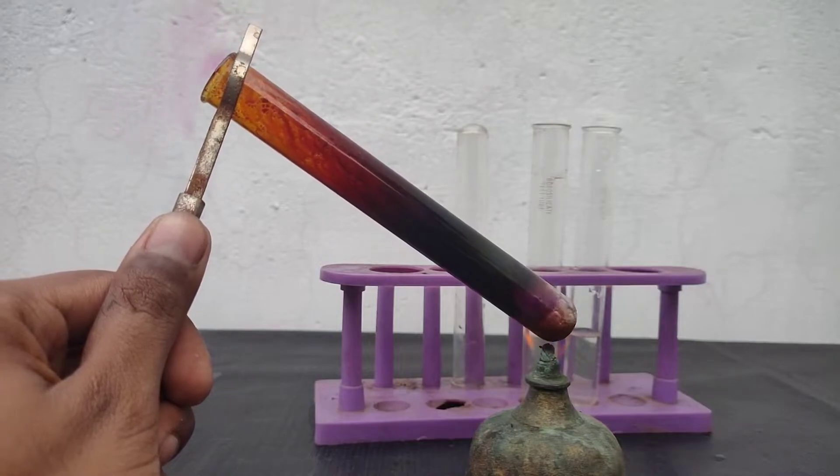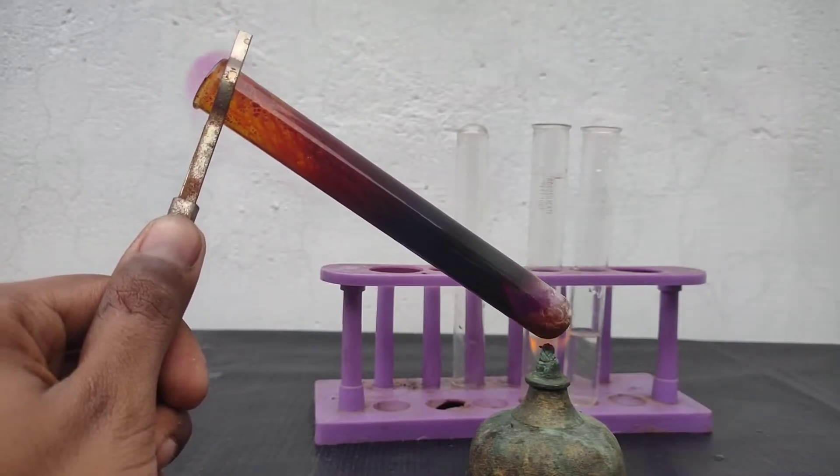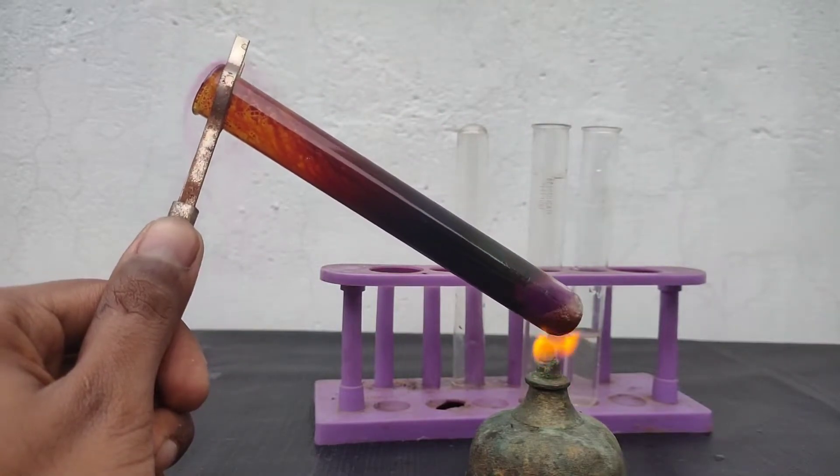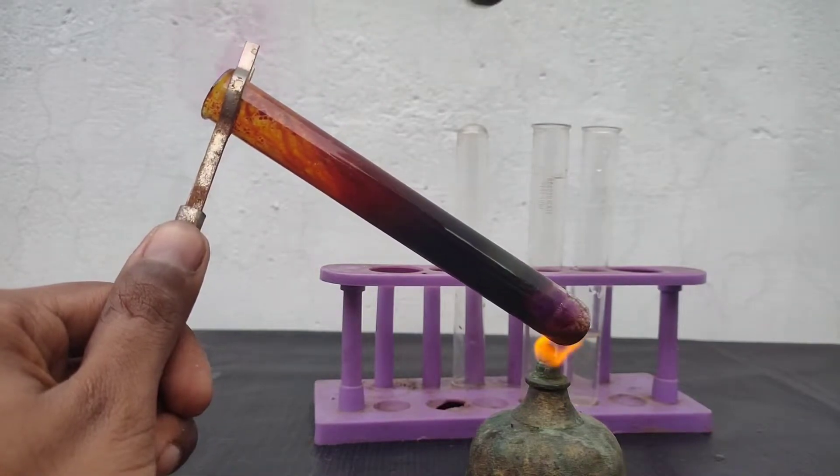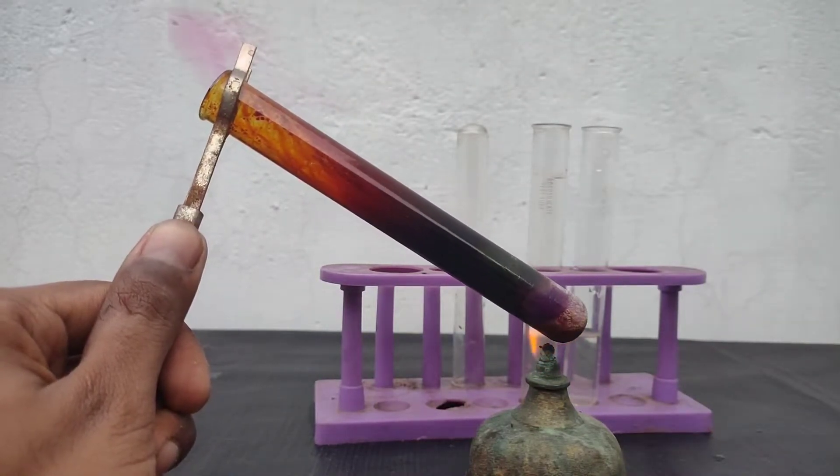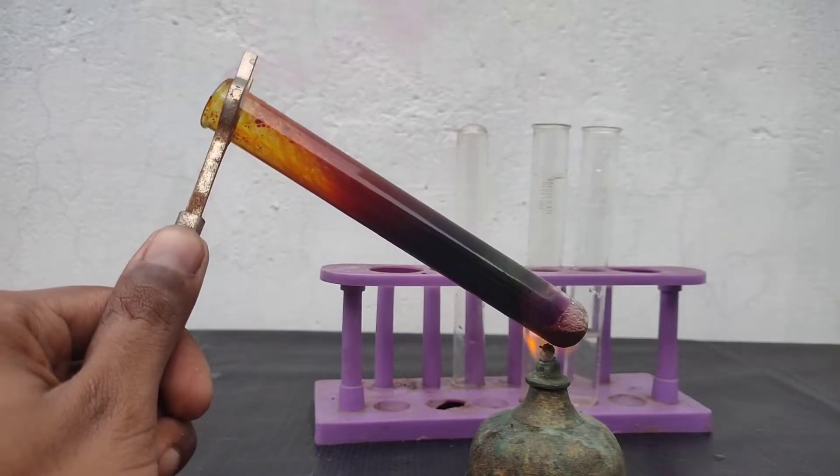These fumes should not be inhaled because iodine fumes are toxic. There is already some iodine condensing on the cooler parts of the test tube. But as the temperature rises, more fumes are coming out of the test tube.